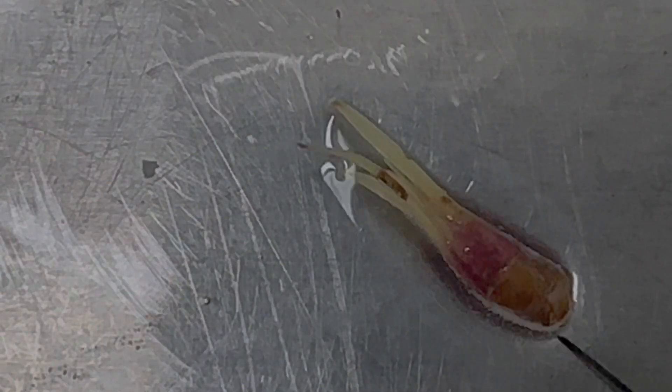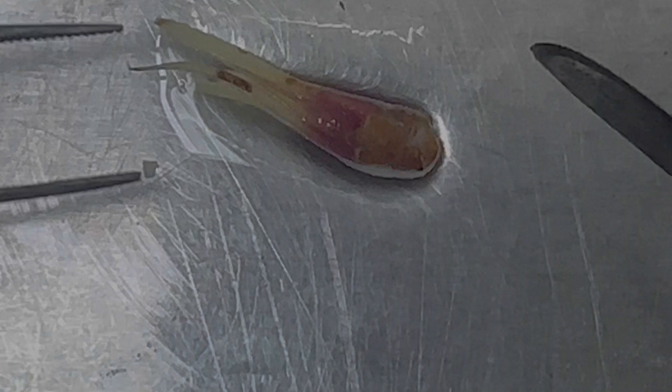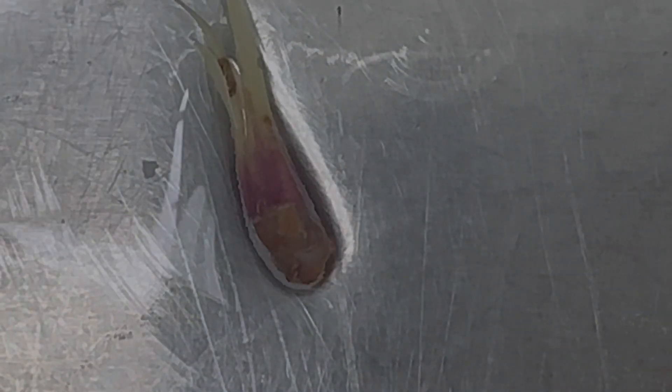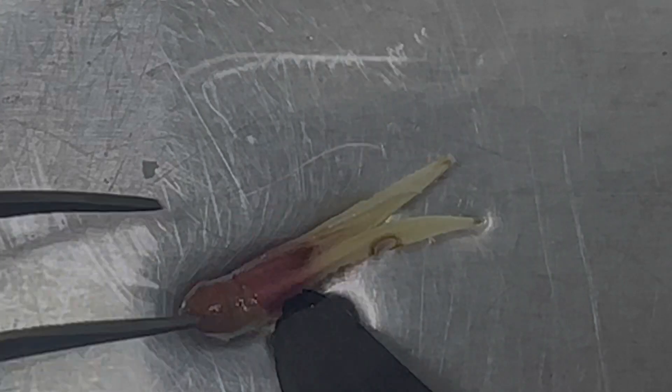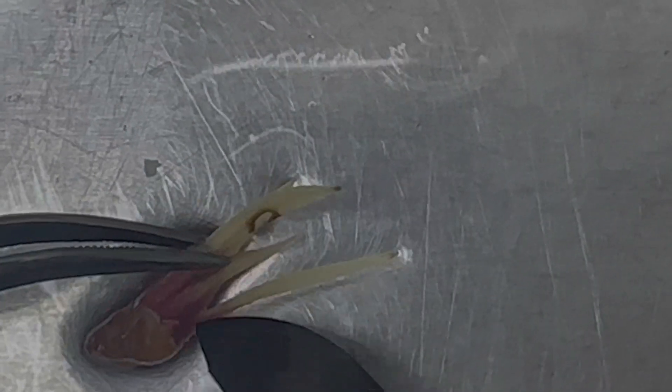So this is the one I'm doing next — you can probably see the process a little better. Here we go. This is the very tip of the plant. I cut it up, sterilized it, and right now you can see a bunch of bubbles from the hydrogen peroxide I'm using to keep it in. What I want to do is carefully remove these leaves. I'm using forceps and a scalpel — you may want to do this with two scalpels, as that might be a lot easier.